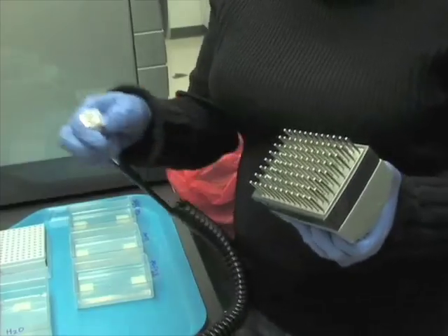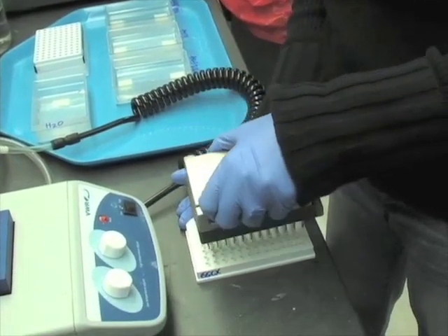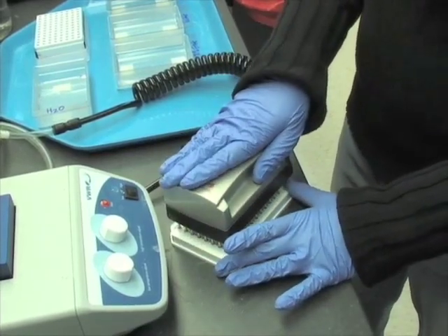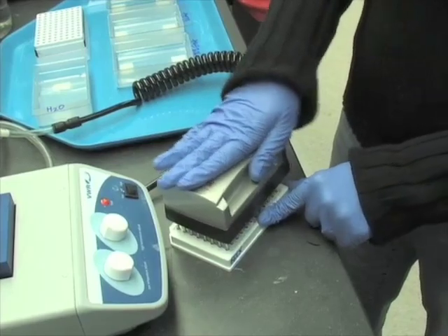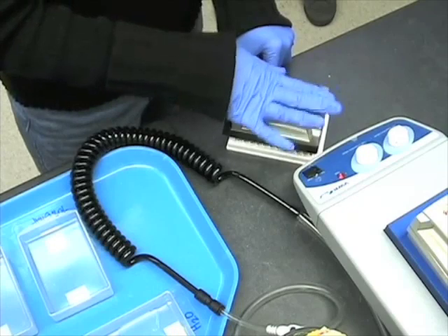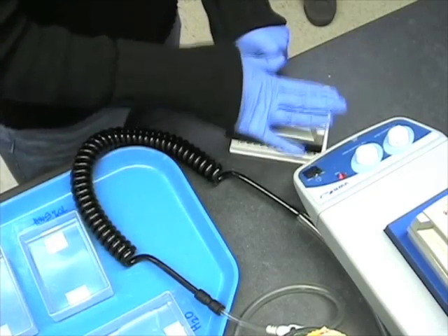Disconnect the vacuum hose from the vacuum tool and place the vacuum tool into the pyrosequencing plate containing the pyrosequencing primer and annealing buffer mix. If the vacuum hose is still connected when placed into the pyrosequencing plate, the primer mix will be sucked through the tips causing you to lose your PCR product. Gently shake or rock the tips of the vacuum in the wells of the pyrosequencing plate to disperse your PCR product.